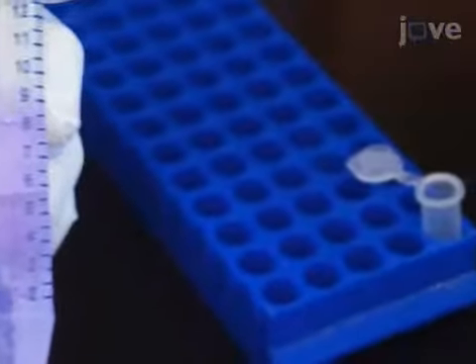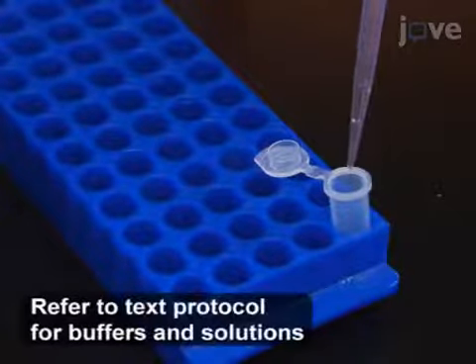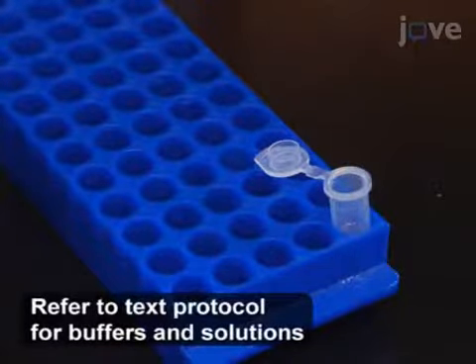Now, while in the dark, add 600 microliters of previously prepared NR working solution to each sample. Invert the tubes 3 times.